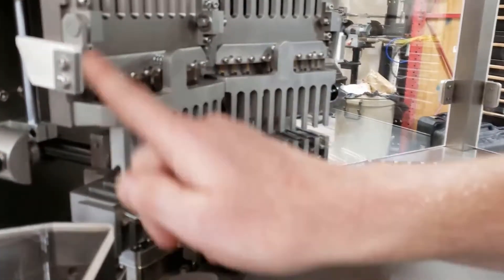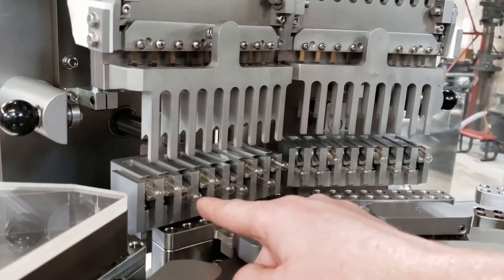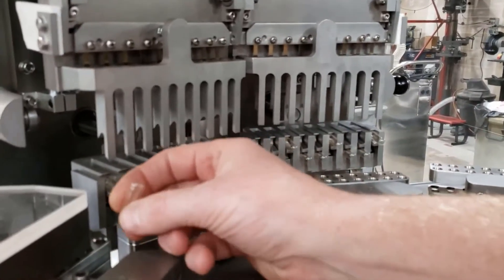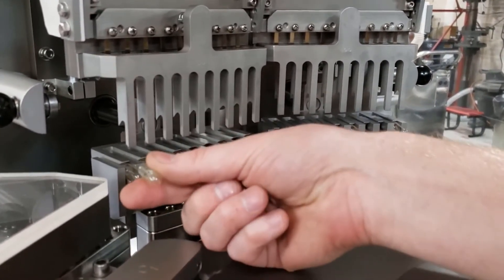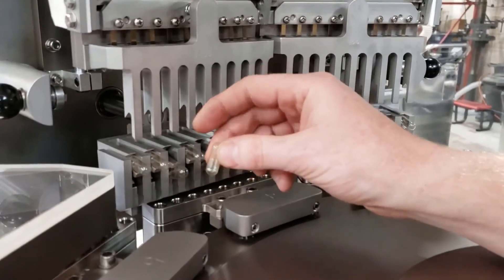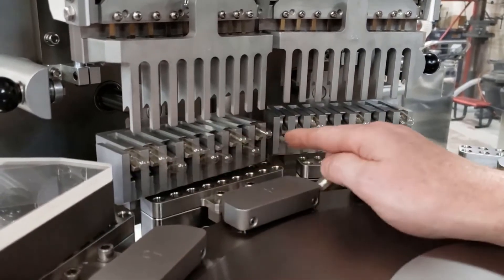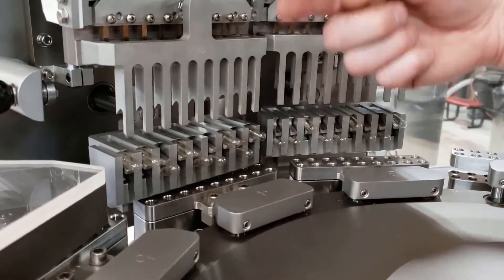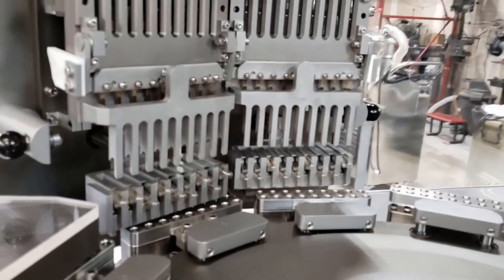Here, depending on which direction they fell down the chute, they're going to stay on the top of the sorting forks or on the bottom of the sorting forks. So it so happens that this capsule right here stood body up or cap up when it rotated, and that's why the body's out. This is the same thing as the cap was down and rotated, so now it's on the bottom side of the fork. But at this point, all the bodies are facing out. Next motion, the front forks here are going to come down, finish making that rotation and feed into the segment.